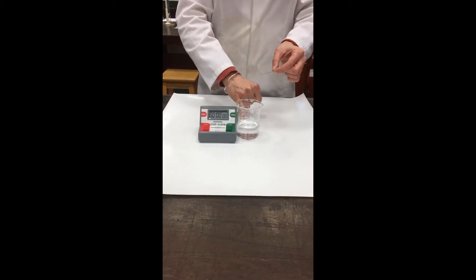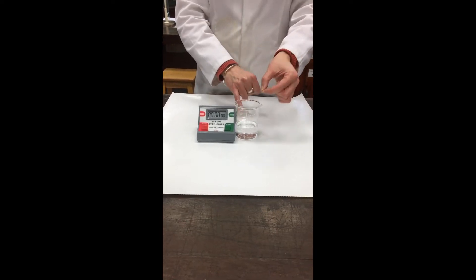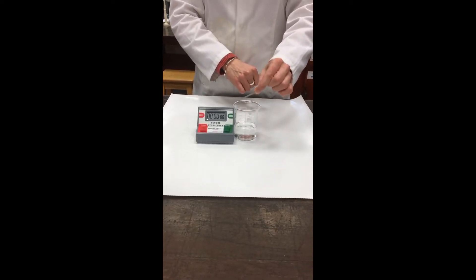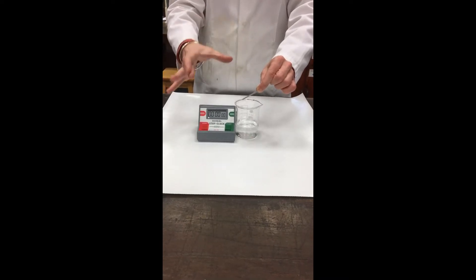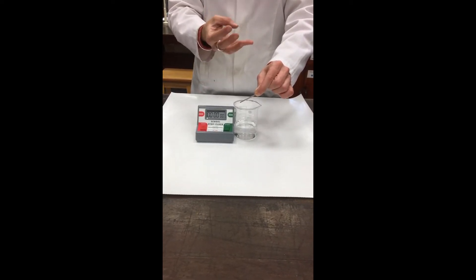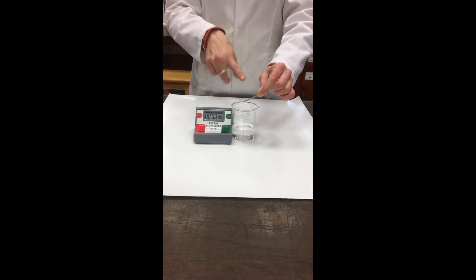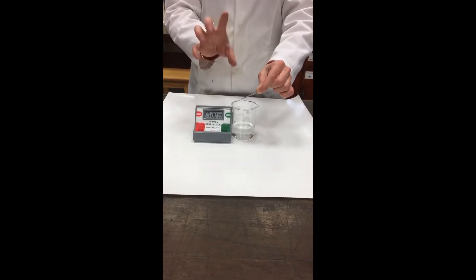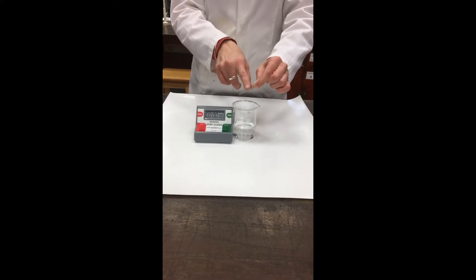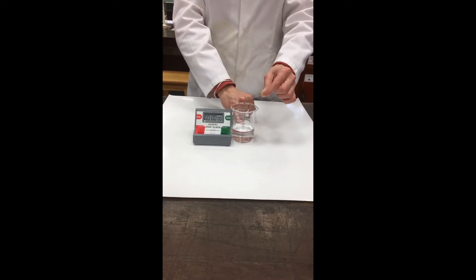I've got a known volume of a known concentration of dilute hydrochloric acid in a beaker, and here I've got a piece of magnesium ribbon. When the magnesium ribbon reacts, the magnesium forms a soluble compound, so the magnesium ribbon disappears. What I'm going to do is take the stopwatch and press start as soon as the magnesium particles are allowed to collide with the HCl particles.